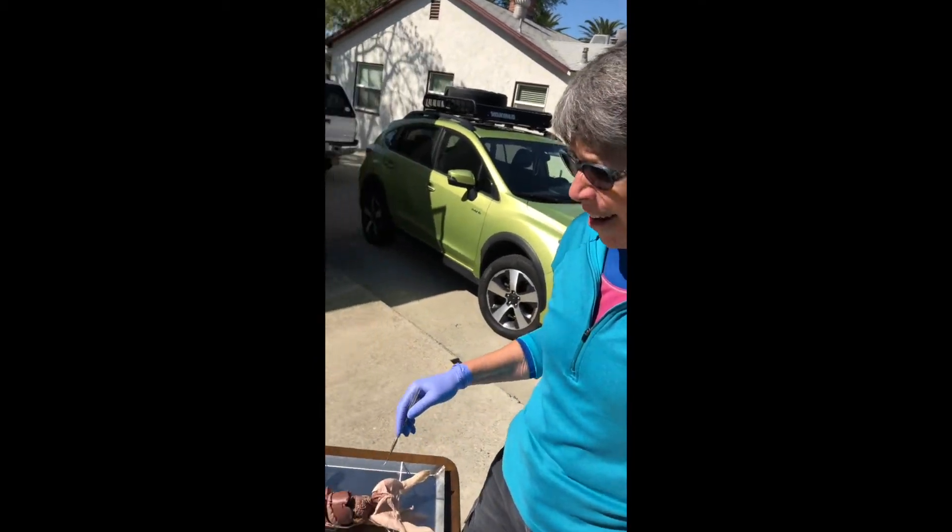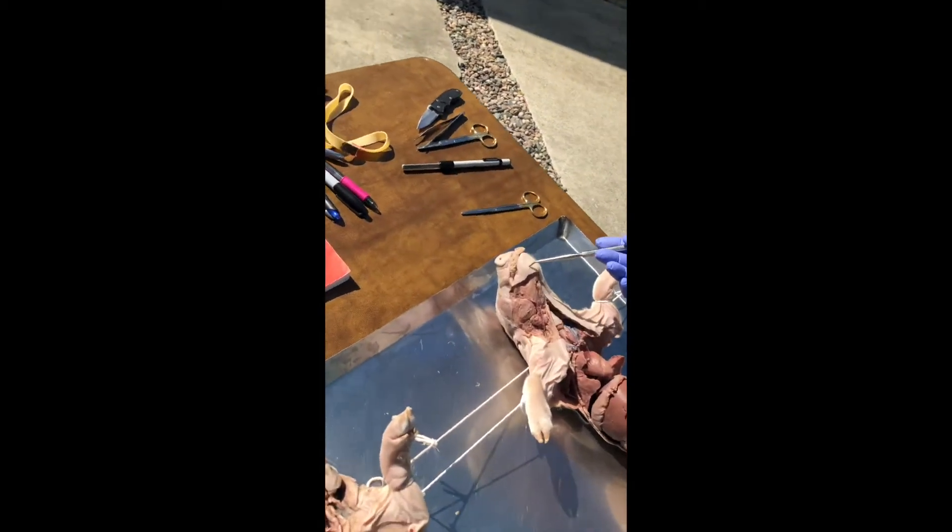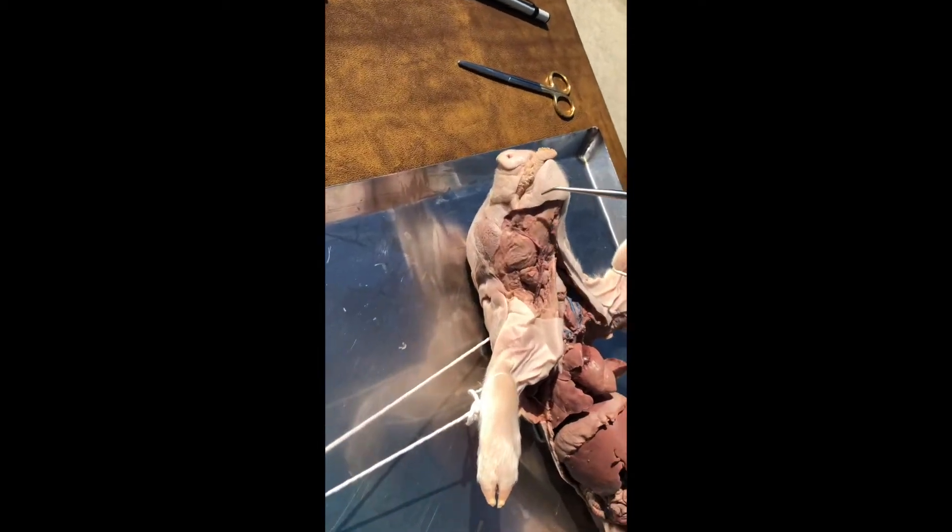We're ready now for pig glands. We're gonna start at the head, work our way down to the neck, that'll take us to the chest, and then in a different cut we'll actually go into the abdominal cavity. This guide's gonna take us two pigs to tell the story.